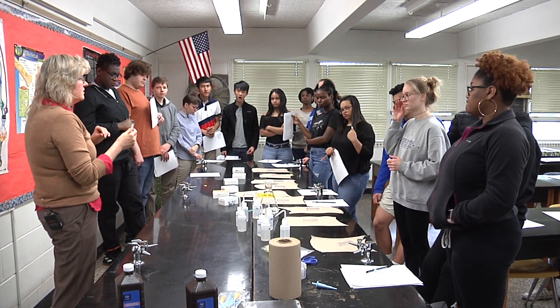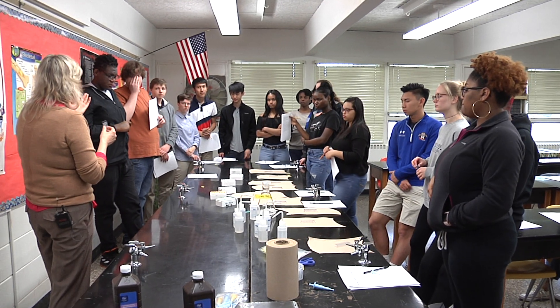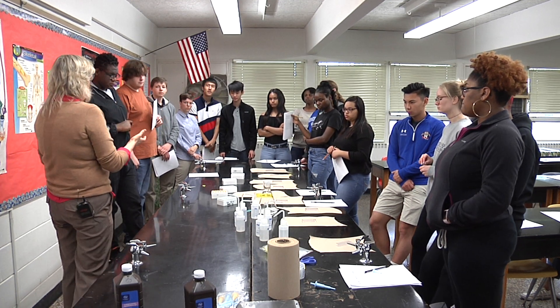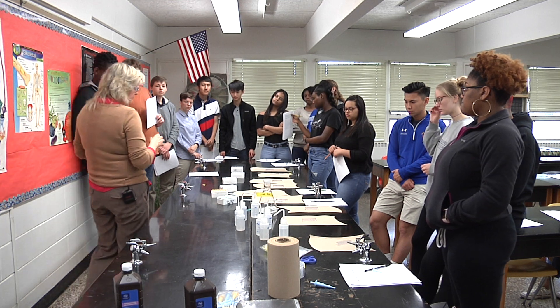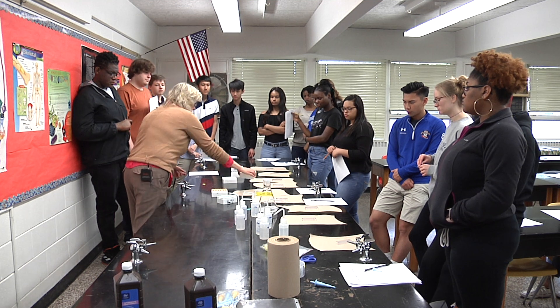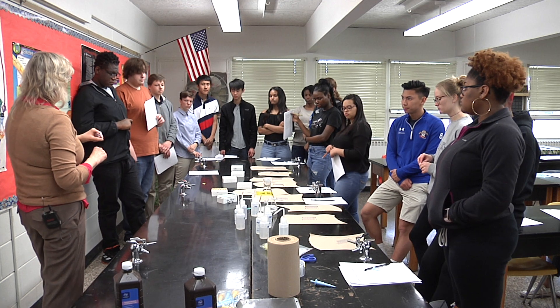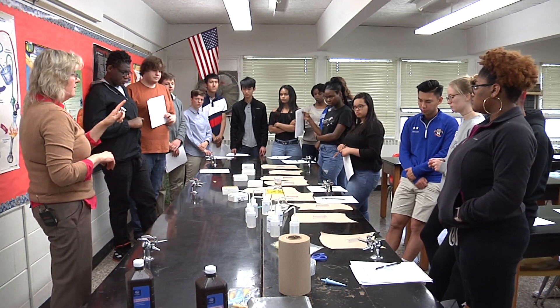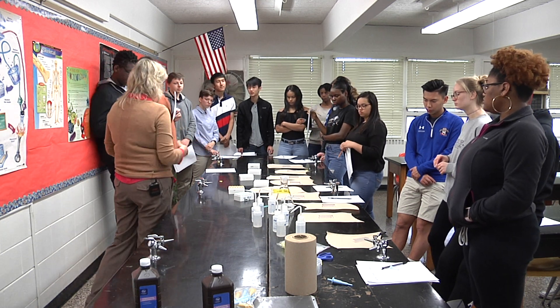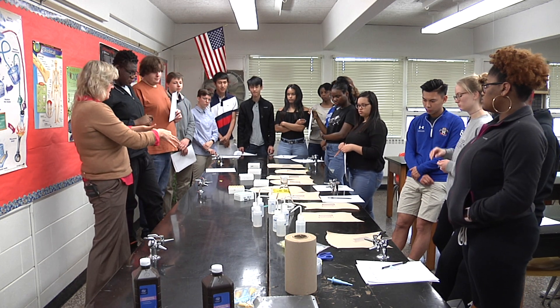Why would we run it three times? Why be redundant? To increase validity. You run it once, you don't know — there may have been an error. So you'll run it three times. We're going to walk through the process of the different steps, and you're going to be able to put your samples in there. Make sure before we move to the next segment that you know what number saliva you had, so you don't get confused with whoever you're sharing the well plates with. Then we'll move into the next phase of actually running this.